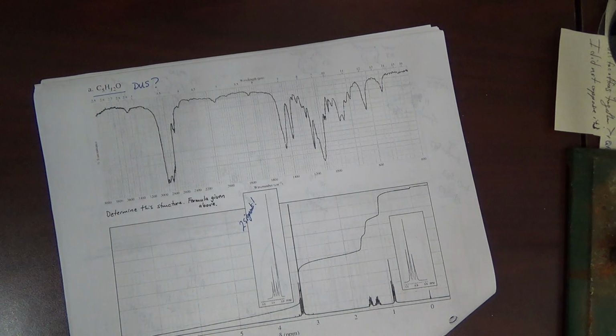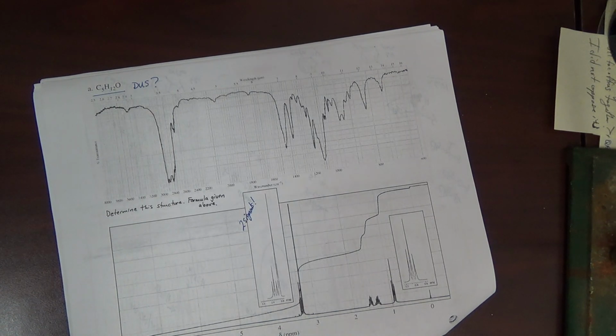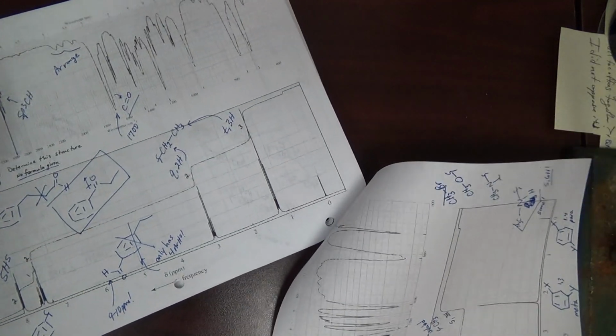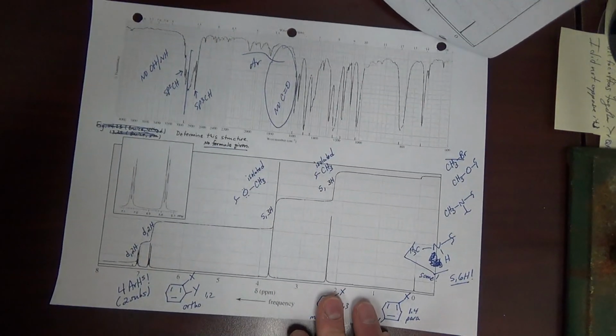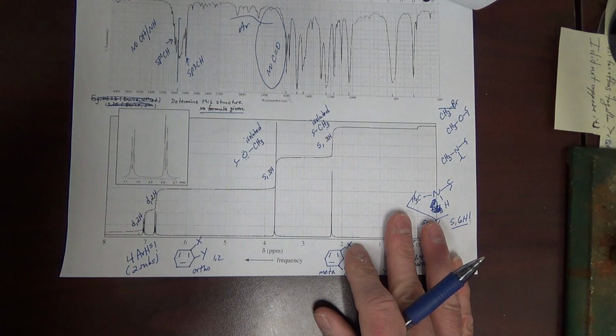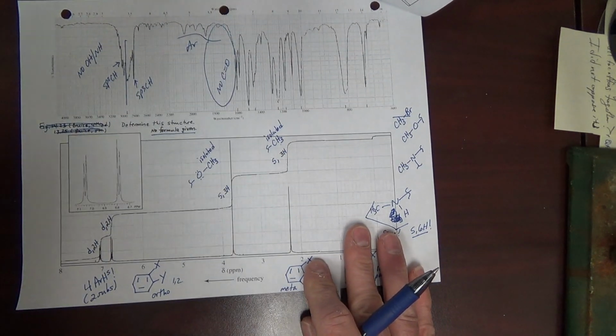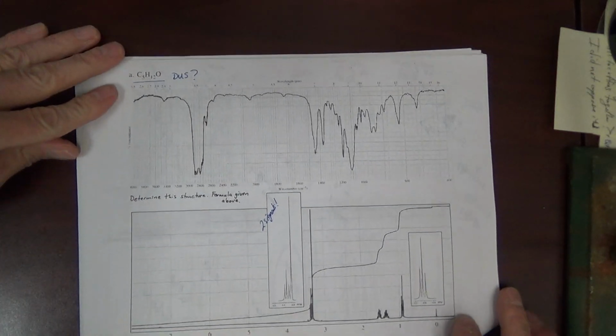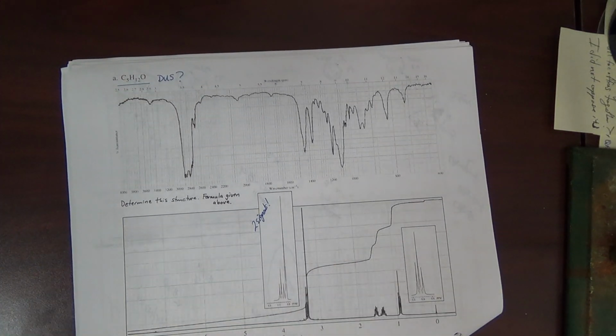Hi guys, in this video I will work a few of the comprehensive spec problems. I'll begin by working one that's in the NMR handout. In the Proton NMR section, we worked the first 3 or 4 of these on a previous video, but the last one, right before the carbon NMR section, I left for you to work. I'll do that one here.